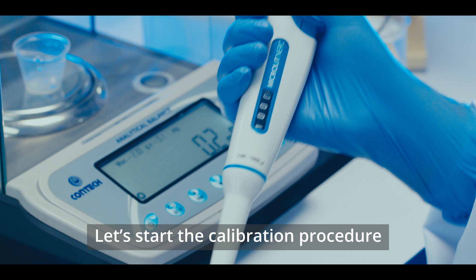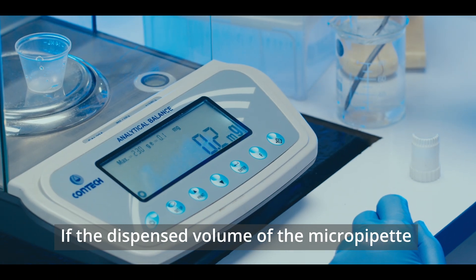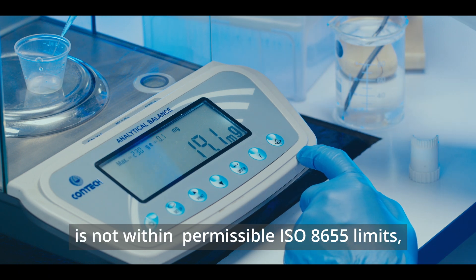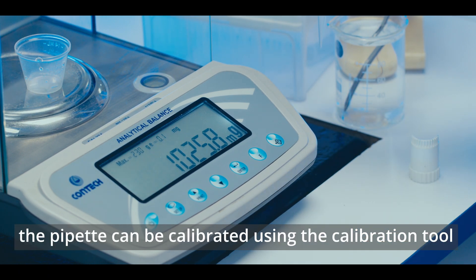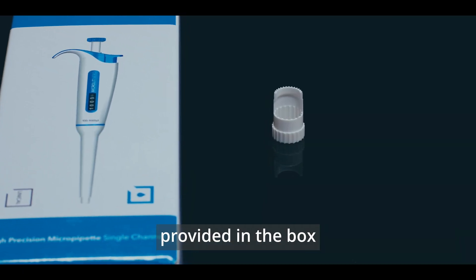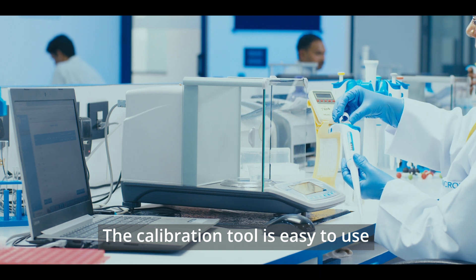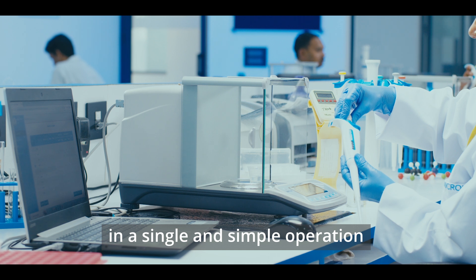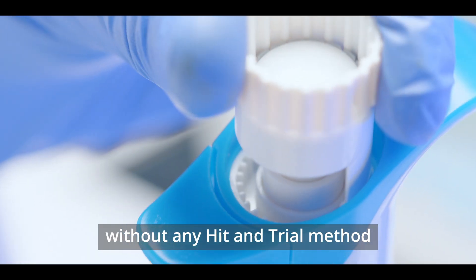Let's start the calibration procedure. If the dispensed volume of the micropipette, as read by an analytical balance, is not within permissible ISO 8655 limits, the pipette can be calibrated using the calibration tool provided in the box. The calibration tool is easy to use and enables the user to recalibrate their pipettes in a single and simple operation without any hit-and-trial method.